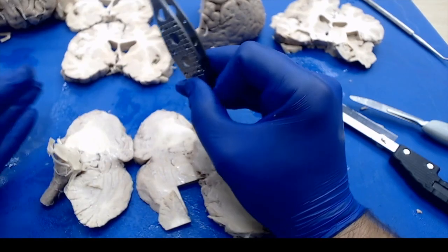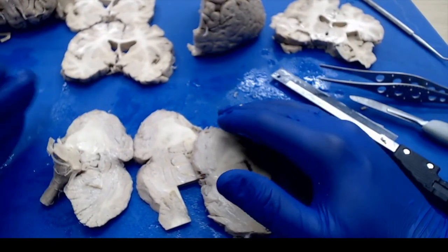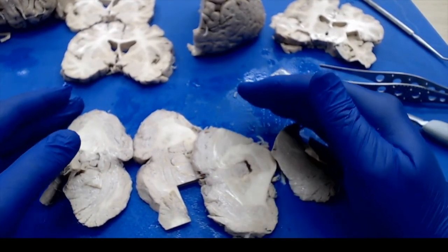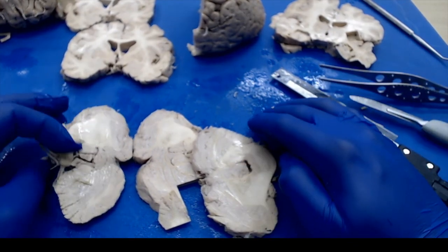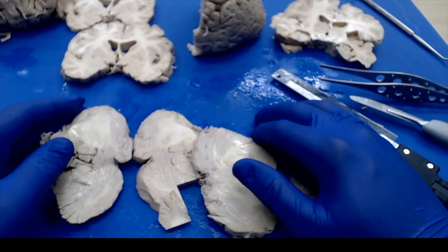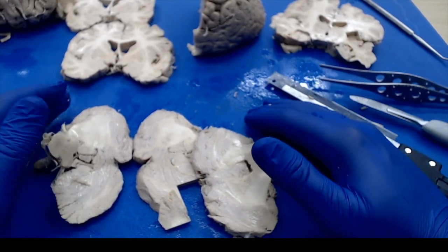Some places, particularly if it's a neurological case, might ask for more. They might want the brain to be fixed longer, or they might have the neuropathologist actually cut it for themselves, and some places maybe even want fewer sections, but those are the basic sections to cover a wide gamut of pathologies that may have been incidental in the patient.